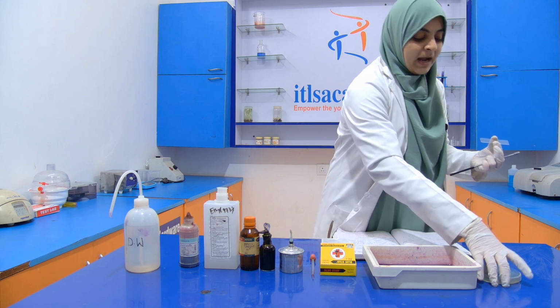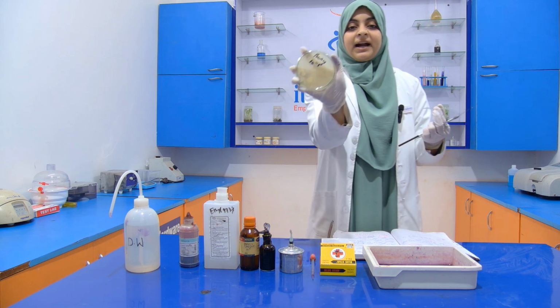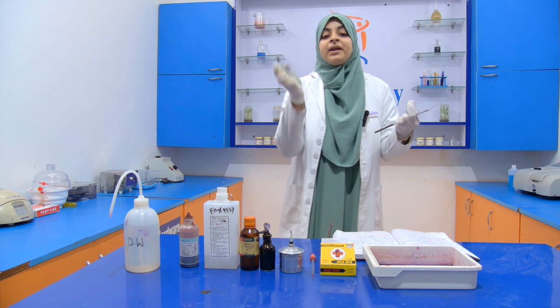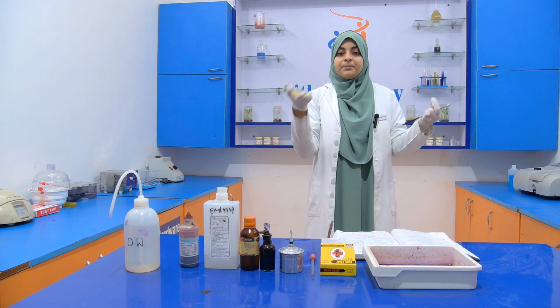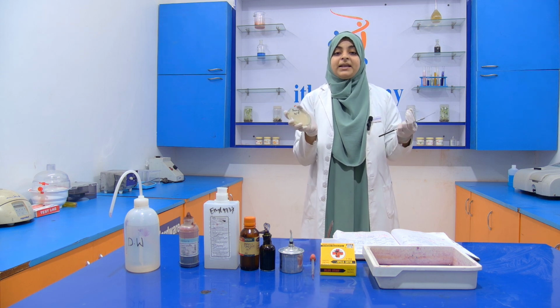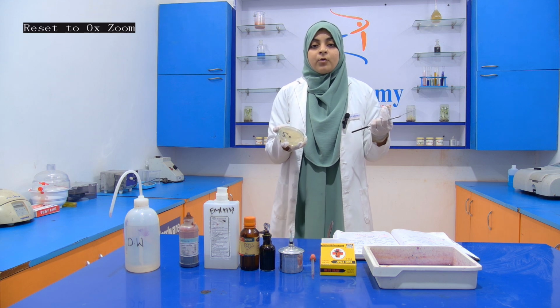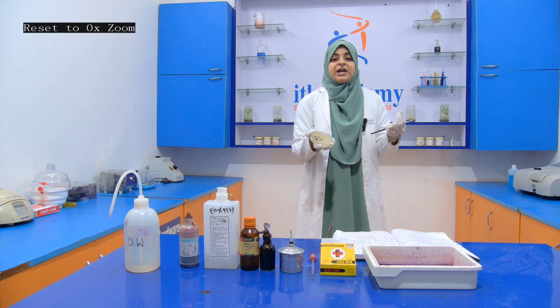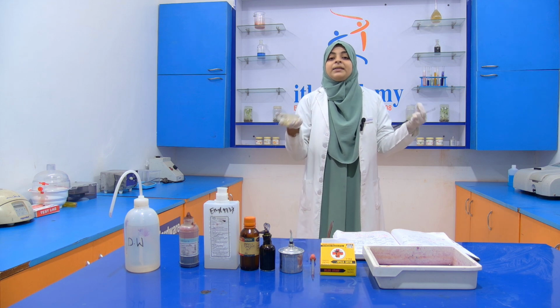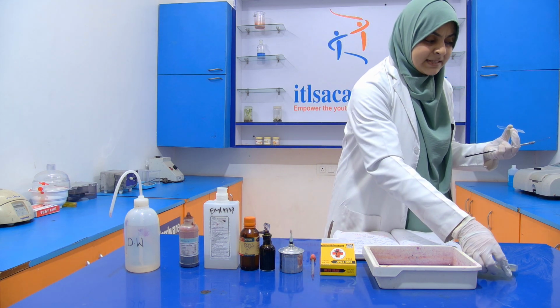Now we already have a culture, that is from your pour plate method technique. How we get that culture, how we prepare the media, how we do a serial dilution and how we perform this technique, the videos related to this are already uploaded in our account. You can visit our YouTube channel and see the videos for your better understanding. Then after that you will perform the staining.